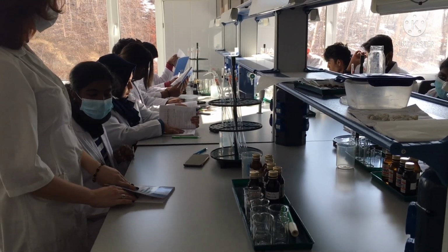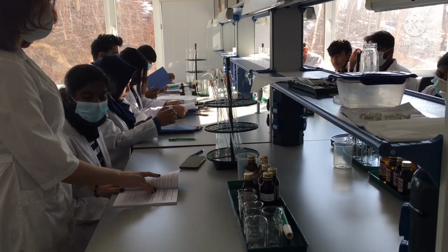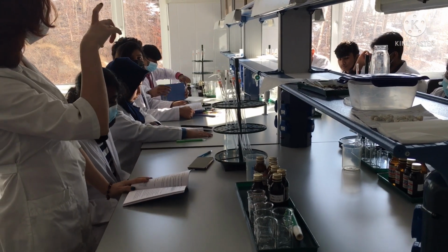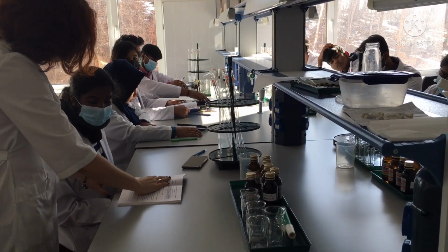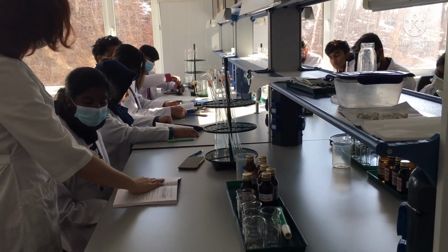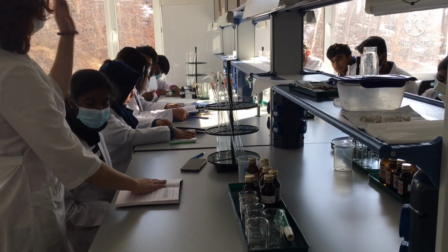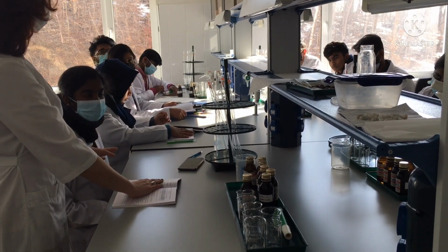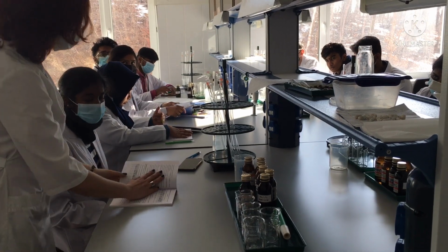So now you prepare the mixture as you did for the first A series. You will put 3 beakers, 1, 2, 3. Prepare all mixtures with the catalyst, and as we did before, when you start the final reagent, you raise your hand and tell that everything is ready, and you will prepare the timer and measure the time. Okay.